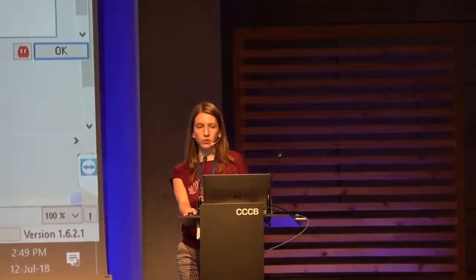You may want to normalize in this case. But again, it's a little bit trickier. So it's better if you can avoid the second bump by playing with the parameter values. That is the right way to do it. So never create really a second separate distribution, because then whatever normalization you do, that's not going to help very much because you have just put way too much noise in the data.